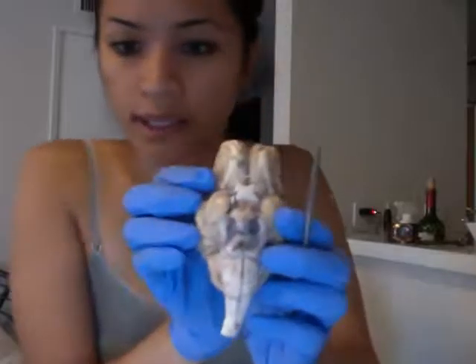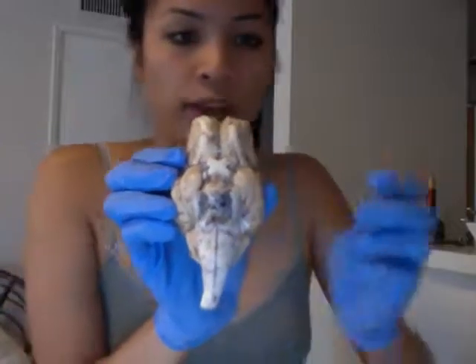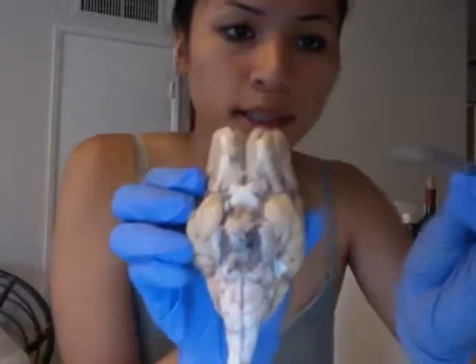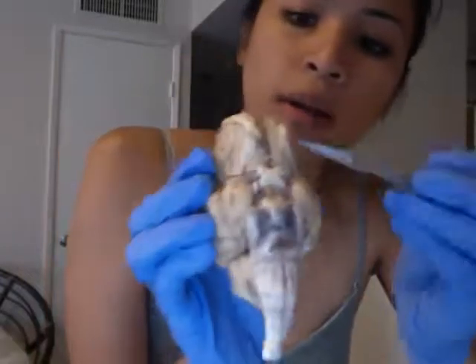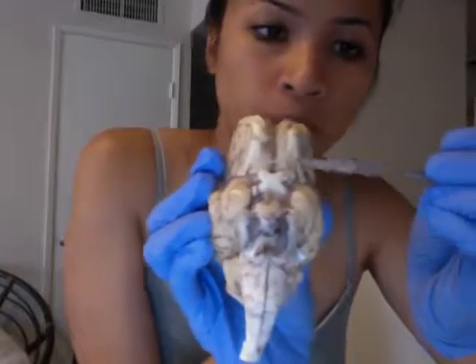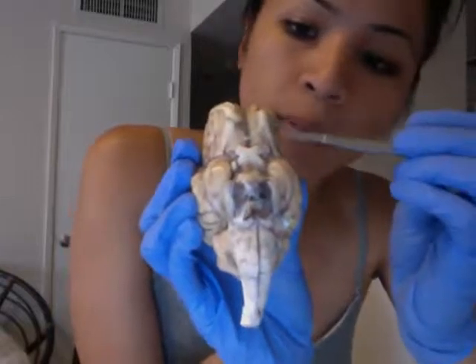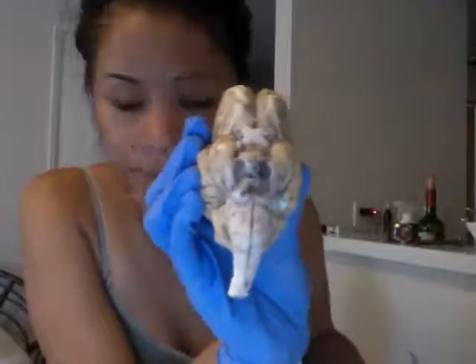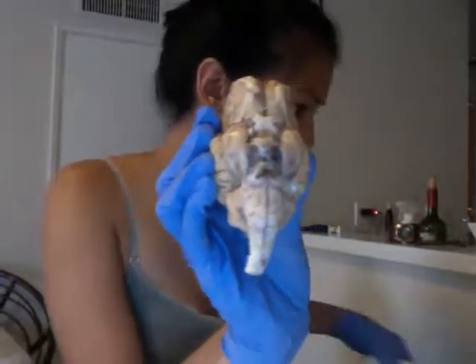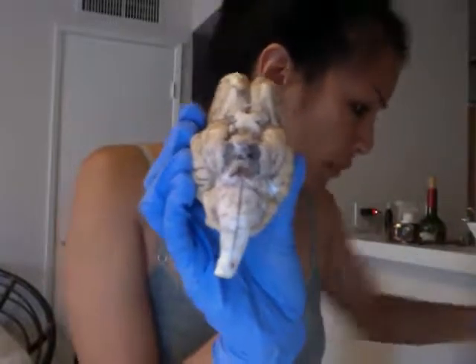On the ventral surface — so that would be this surface — it says to point out the olfactory bulbs. It's a little hard to see; I think mine is a little torn up. But the olfactory bulbs would be here, and the tract is what surrounds it. The optic nerves — this one was a little tricky for me to find. The optic nerves are over here; they're very tiny nerves, with two on both sides.